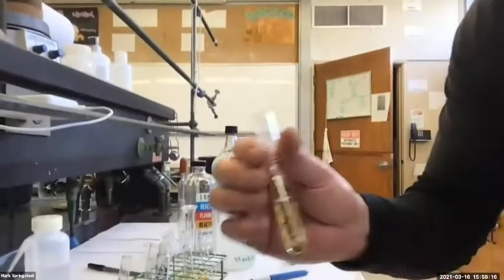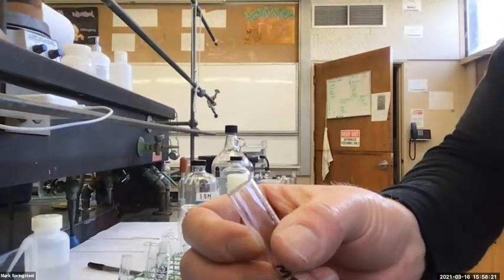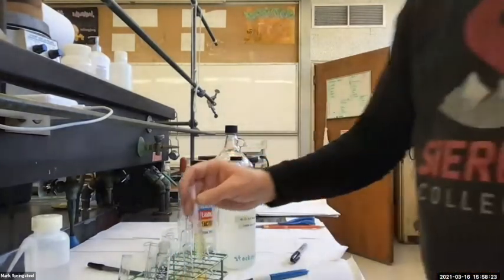What do I do next? Do we do the brine wash? Or, yeah, it's up to us actually. Methylene chloride doesn't hold a lot of water in it, but maybe I wasn't the best at separating my layers. I see little spots of water in there. Yeah, let's go ahead and do the brine wash.